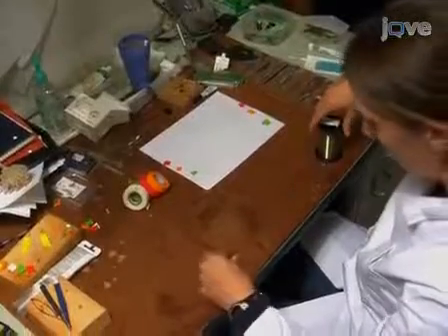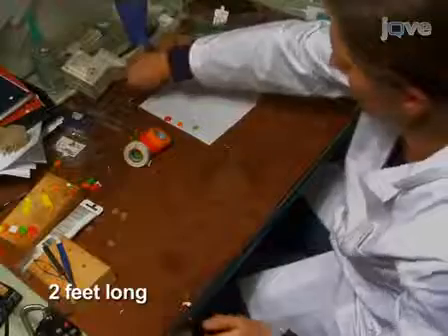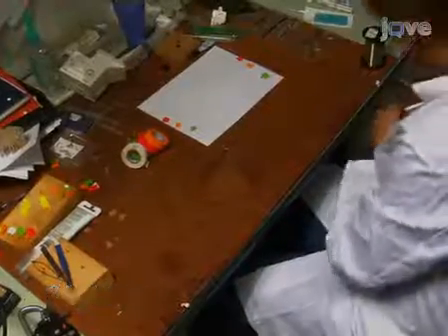To create the electrode, use scissors to cut a piece of enamel-coated 0.001 inch diameter stainless steel wire about 2 feet long. Attach a small ball of putty to each end of the wire, fold the wire in half, and spin the ends to create a twisted pair, called a differential electrode. Tape both ends of the wire to prevent unraveling.